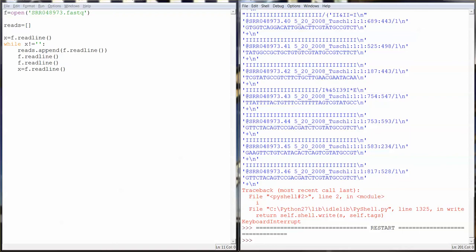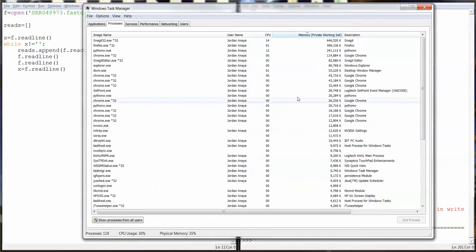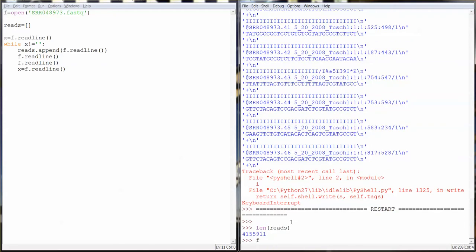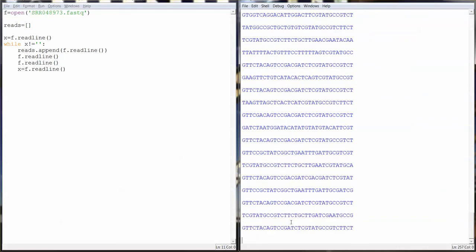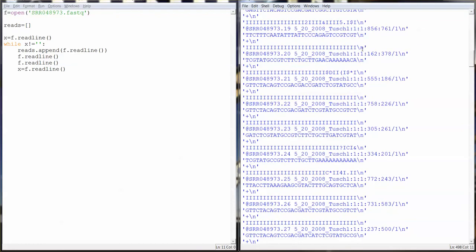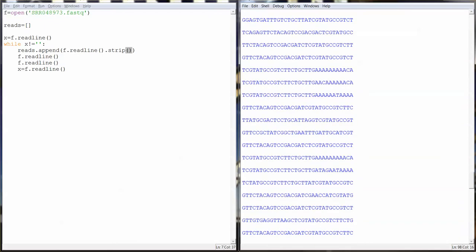So whenever you're reading a very large file, you should make sure that your RAM can handle putting all that data into a list. So we seem to be okay. It's done. We can see how many reads we have. We have over 4 million reads, and we can check to make sure that we parsed it correctly. Oh, so one thing I forgot to do is I forgot to take off the newline character that was on the read. So I'm just going to do a strip right there, and now we're going to be ready to go. So how are we going to find this adapter sequence?